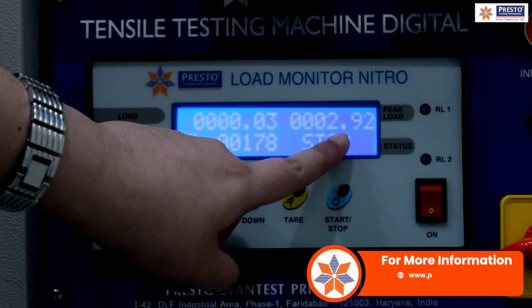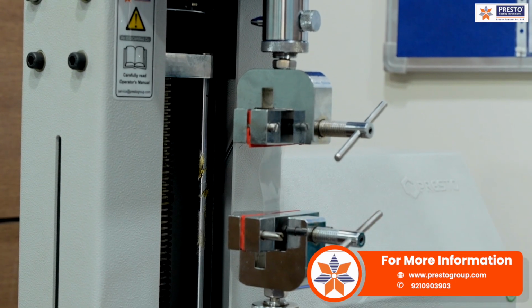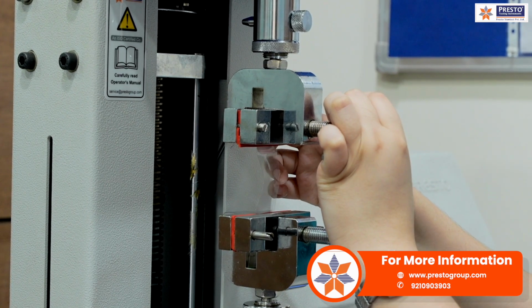So load and elongation are recorded digitally. Now it is important to ensure no slippage and avoid stress concentration due to poor grips. So suitable grips are very important.